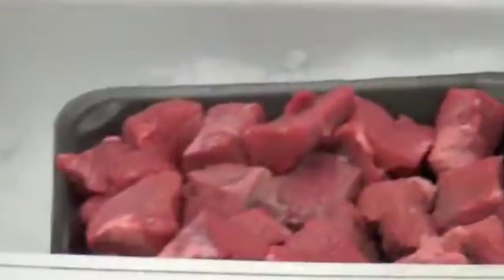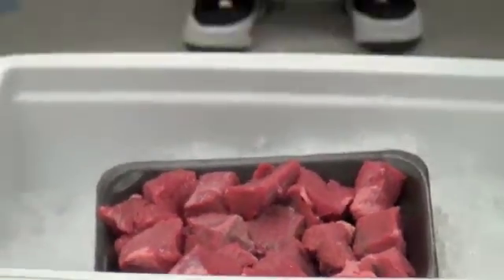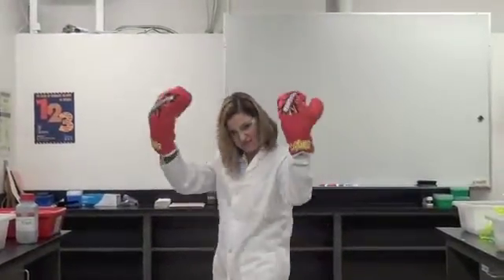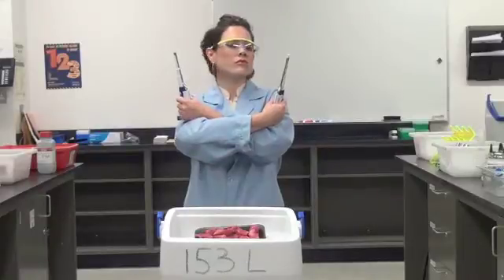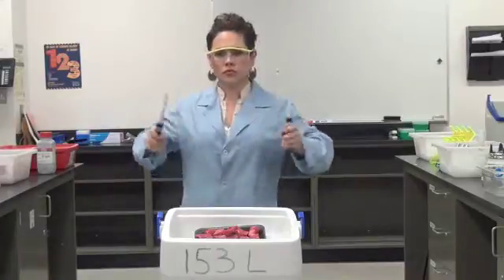Welcome to Hemoglobin Arena. Today's experimental challenge: isolate and purify lactate dehydrogenase from bovine muscle tissue. This week's challenger, Ina Curate, boasts her skill in using biochemical kits, doesn't waste time in tedious steps, and likes instant ramen while watching daytime soaps all day. Challenger Curate will be facing Ionic biochemist Dicer, specially trained at the University of California, Los Angeles, and is notorious for chewing up challengers and spitting them out like a bunch of oligos.